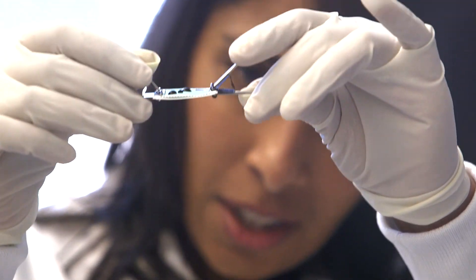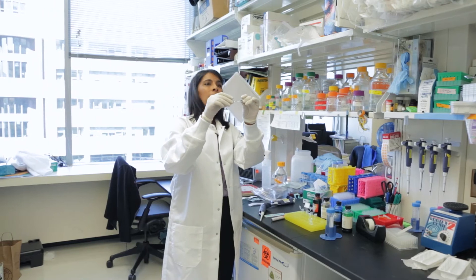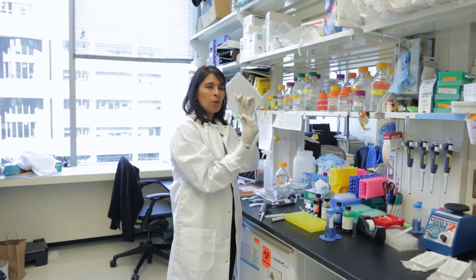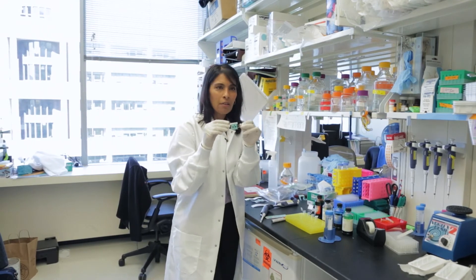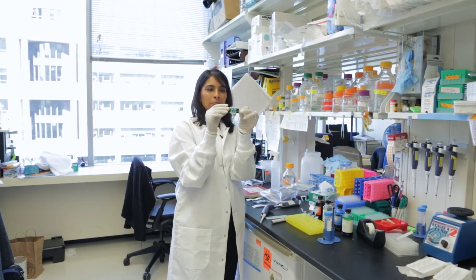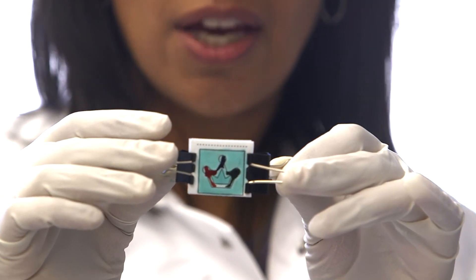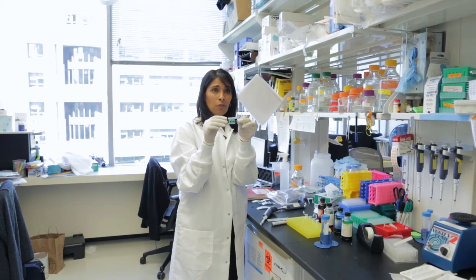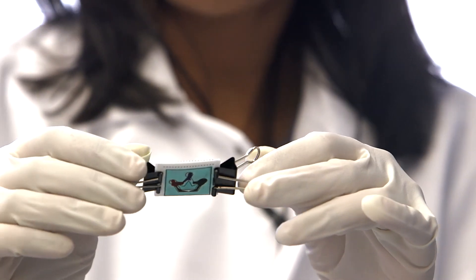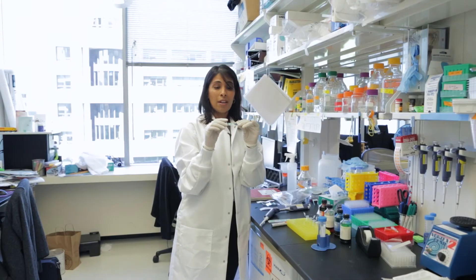You can already start to see colors are coming through on the backside of this object. The interesting thing about this is that, if you remember, the red dot was on the bottom corner — now you can see where it's coming out. The crown is coming out on one side. That's because the fluid has been rerouted by the network that we've created with hydrophobic and hydrophilic surfaces. The motion of the fluid is driven by capillary wicking, which is a process driven by surface tension — the way that liquids interact with surfaces and air.